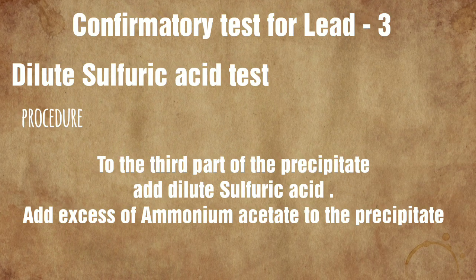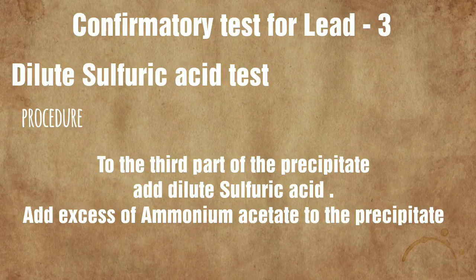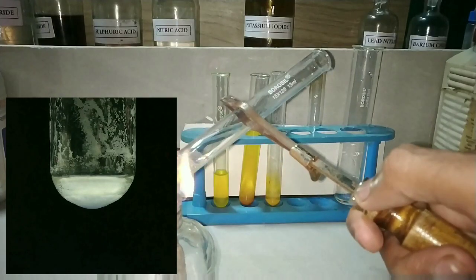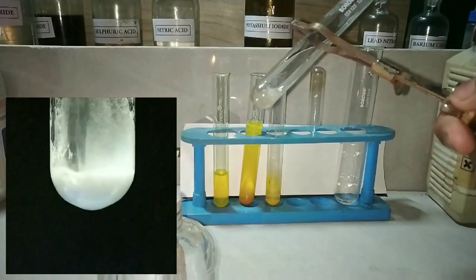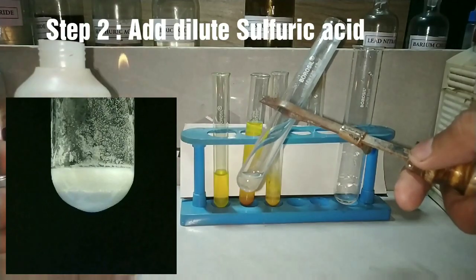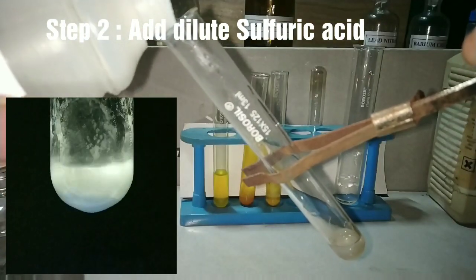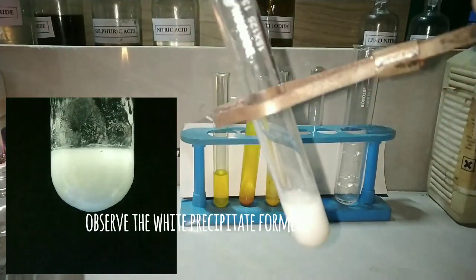The dilute sulphuric acid test involves boiling the third part of the precipitate to dissolve it, and then adding dilute sulphuric acid. After dissolving by boiling, we add the dilute sulphuric acid. You can see that on adding the dilute sulphuric acid, there is formation of a white precipitate.